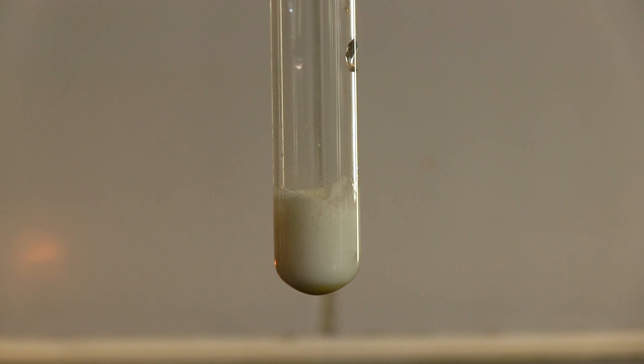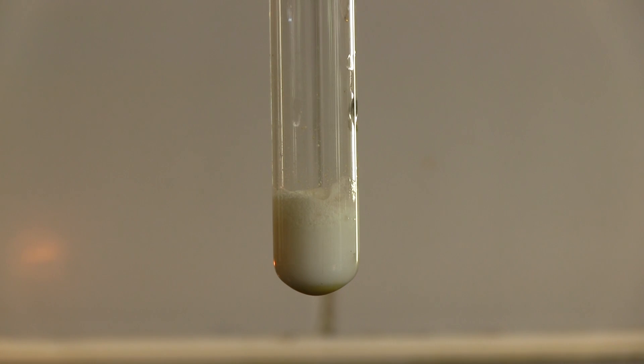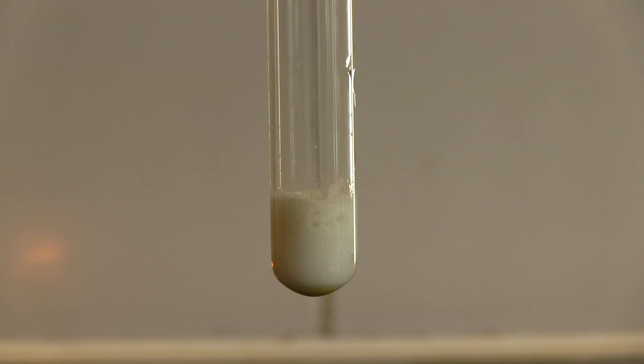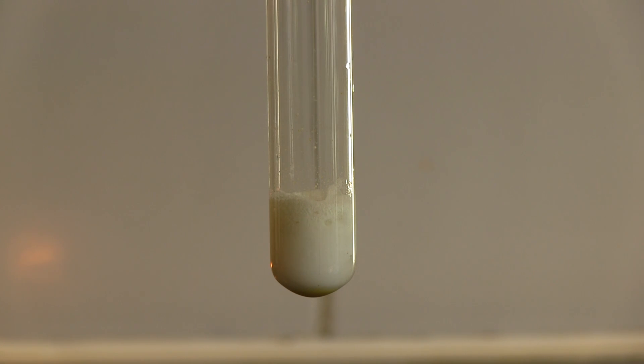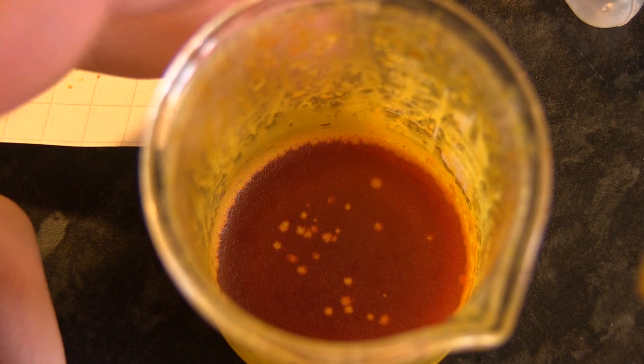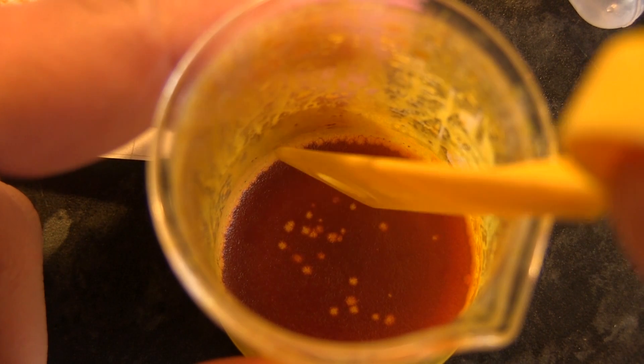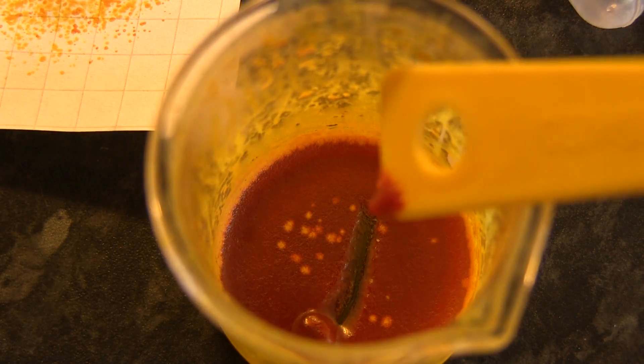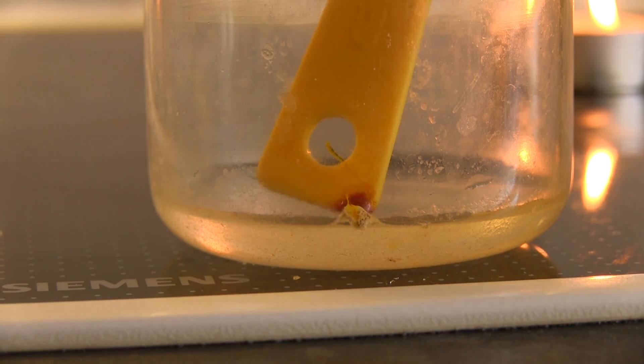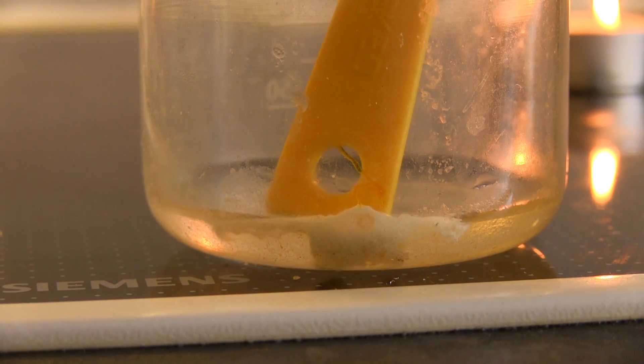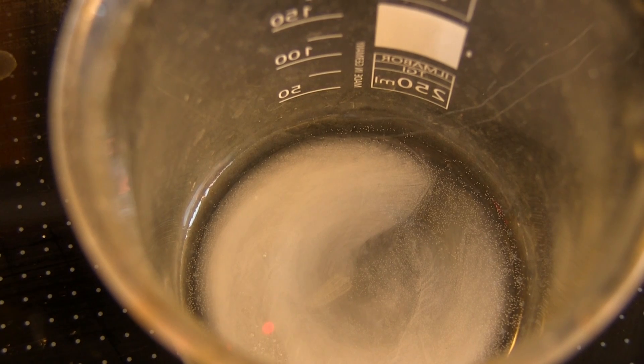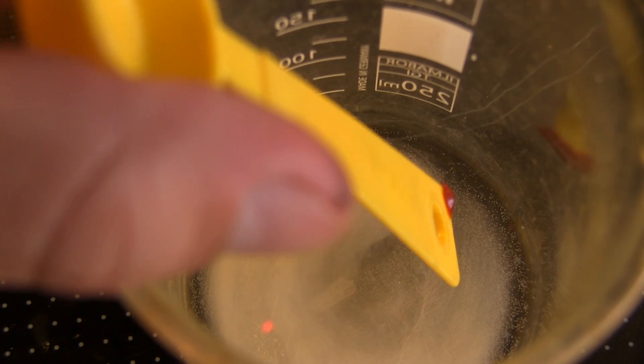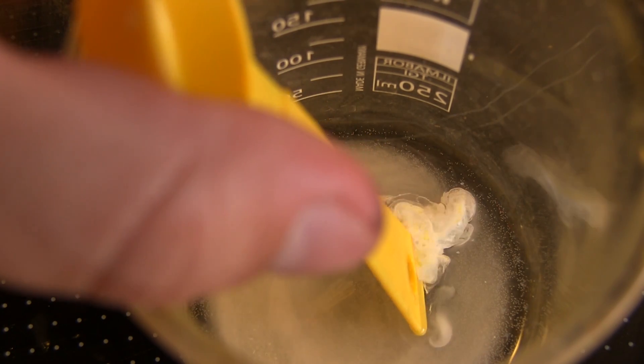A reaction occurred and most of the sulfur probably precipitated out, but some of it converted into most likely hydrogen sulfide because of the smell of rotten egg that filled the room. Later I dried the liquid in a small beaker so it became a form of paste, then I took some of the paste and put it in the vinegar. I did that two times before I no longer could stand the smell.